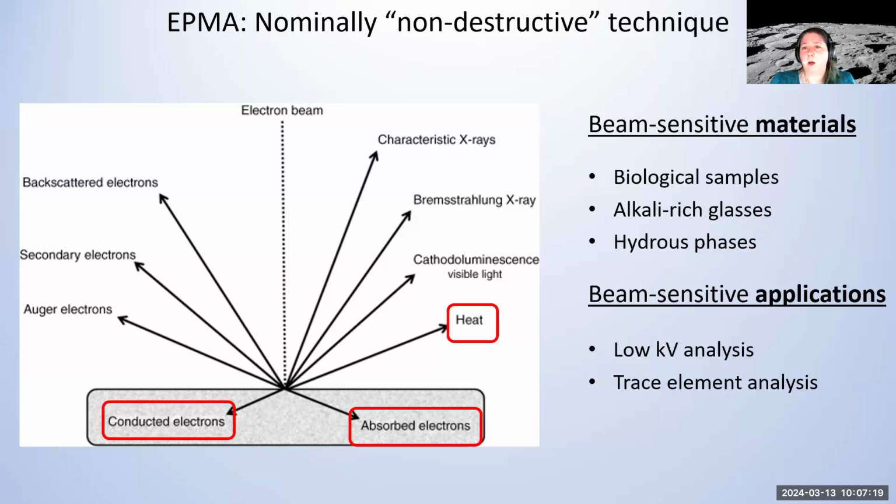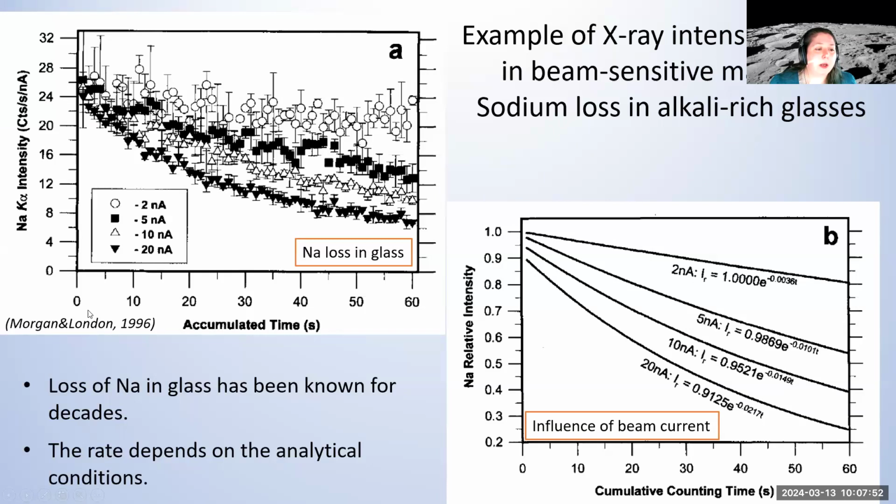materials that are fine to analyze at 15 kV can then show beam sensitive behavior if you analyze them at 7 kV or 5 kV. And likewise, trace element analysis, it's one of the fortes of the microprobe method, that we can analyze minor to trace elements. And we usually have to increase the current to do that. And that often is not received well by a lot of materials. Okay. So what do we see then? Here we have plots where we look at time of analysis versus the intensities in a given material. And what we can see often is that over time, we lose or increase X-ray intensities.